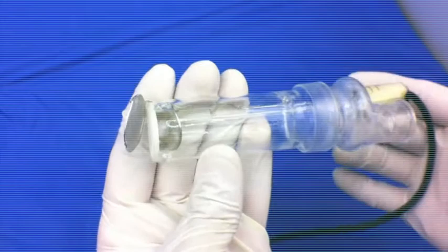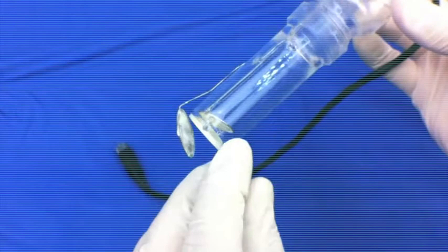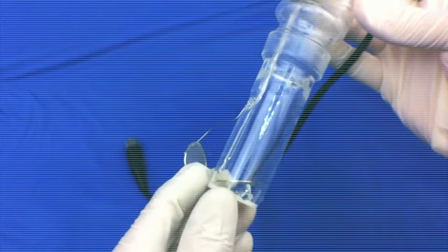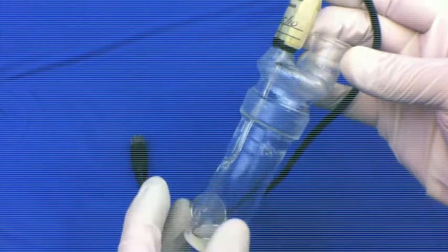This generator electrode can be repaired. This particular generator electrode is configured as a dual reagent electrode and is identified as such by closely examining the bottom portion of the electrode where a small thin white wafer can be seen.